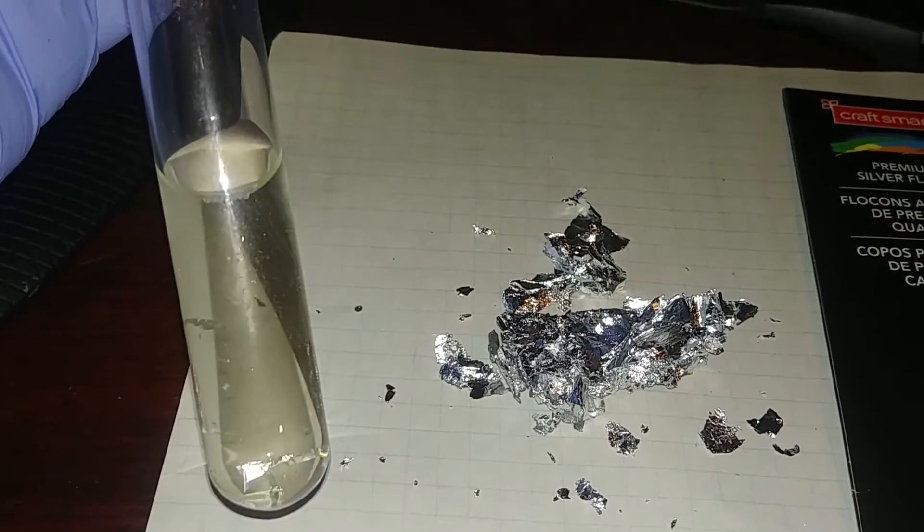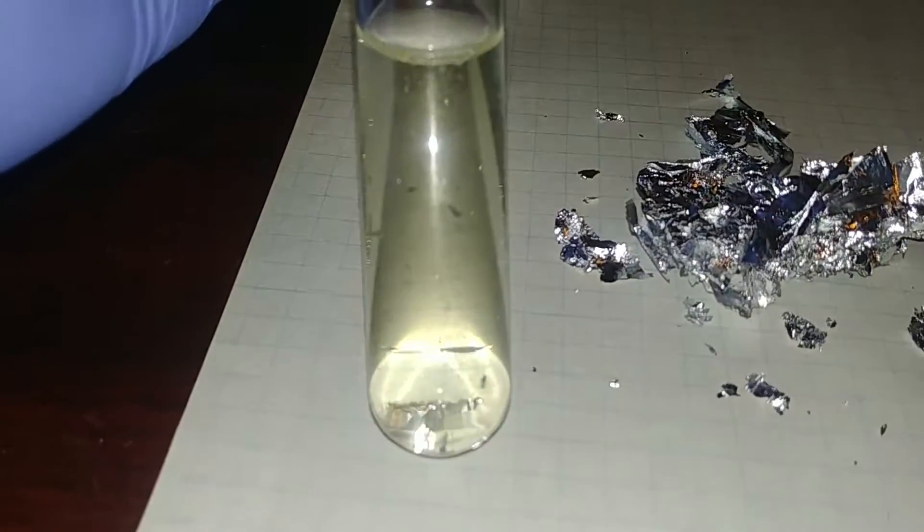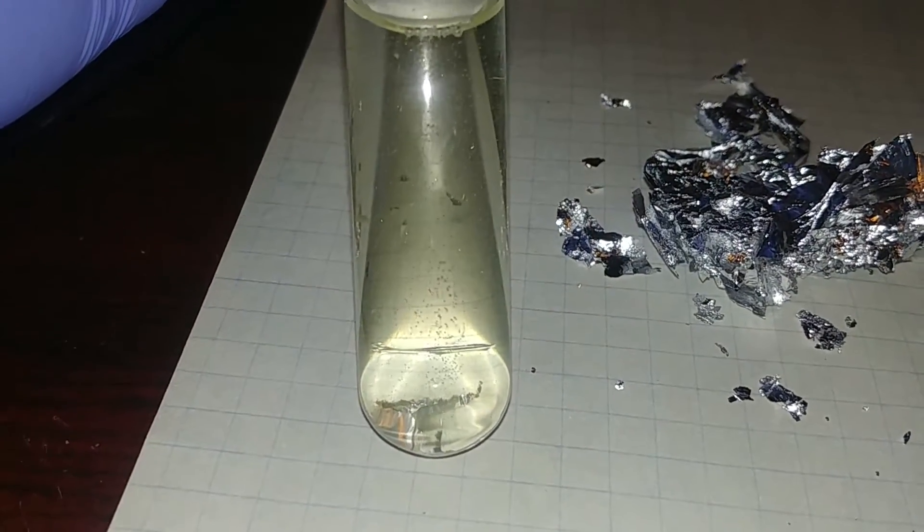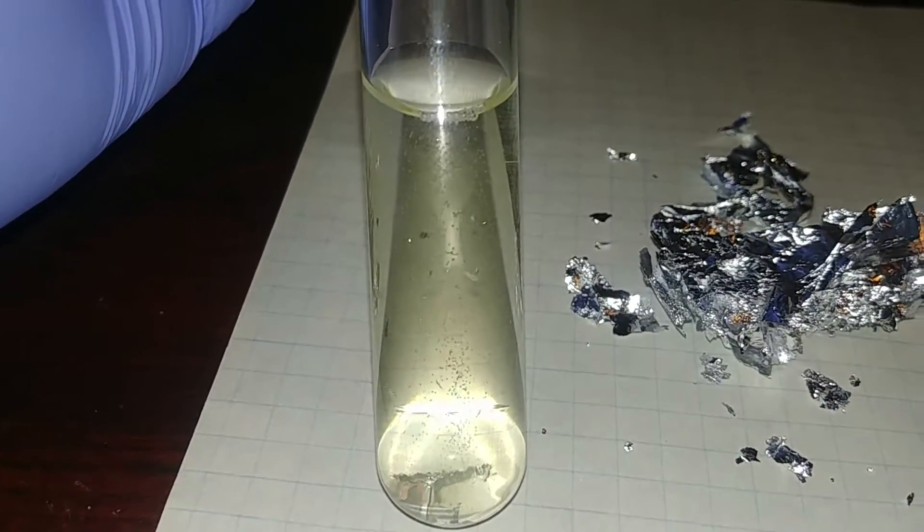Yeah, this is nitric acid alone. And right now, I'm not sure if you can see that, but it's still bubbling and almost all of the silver is gone.